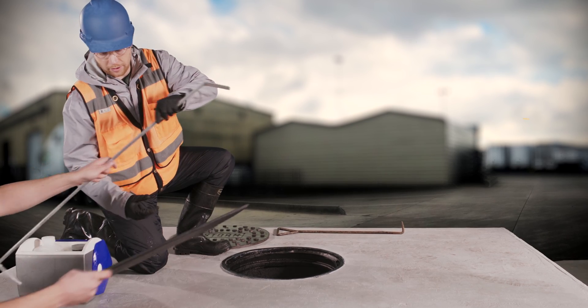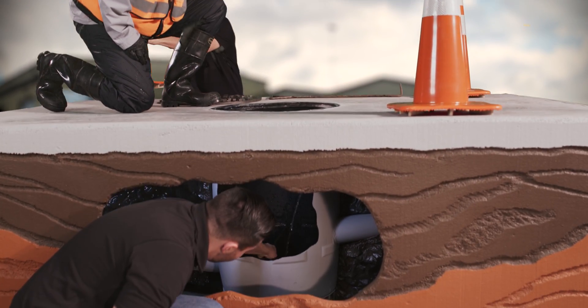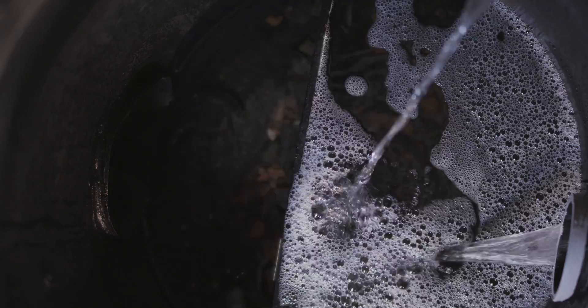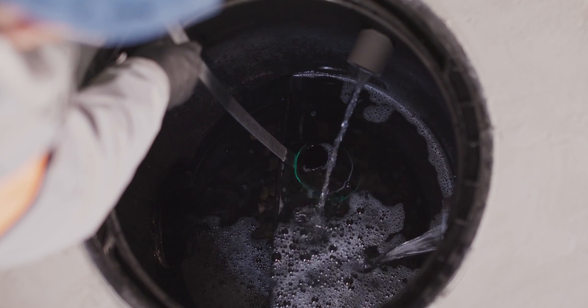After studying the facility's drainage system, the QISP determined that the water from both lines was industrial stormwater runoff and that a representative sample should be taken after the water from the pipe commingles with the water in the conveyance line. To solve the low-flow situation, the QISP recommended the facility install a weir inside the manhole, epoxied to the side to prevent leaks. The weir causes water to back up and become deep enough to collect a sample with the bottle. Be aware this changes when your facility discharges — only collect samples after water flows over the weir and initially impounded water clears. The area upstream of the weir will accumulate sediment and will need regular inspections and cleaning.